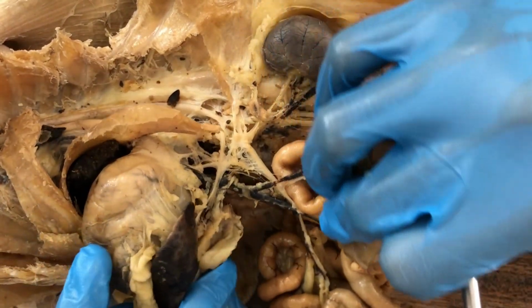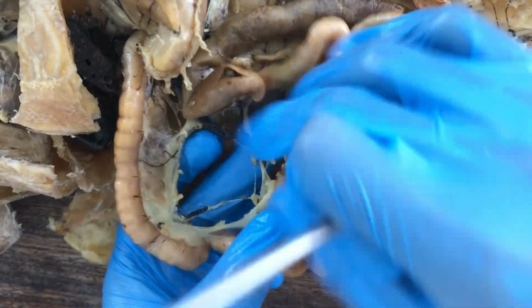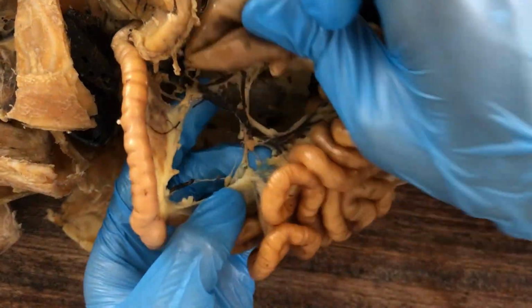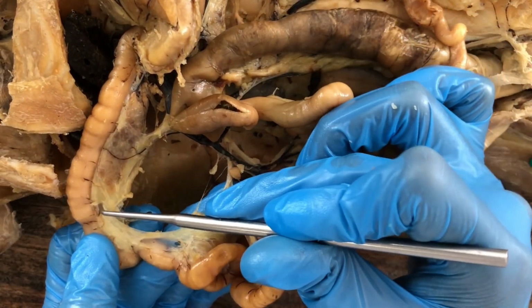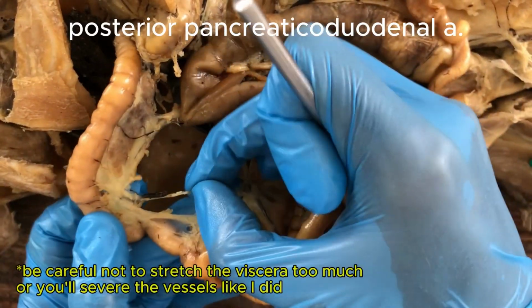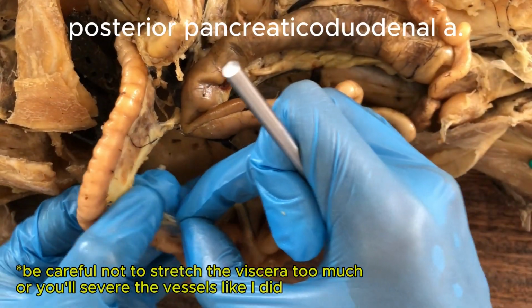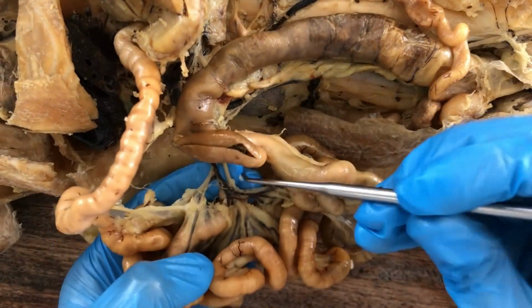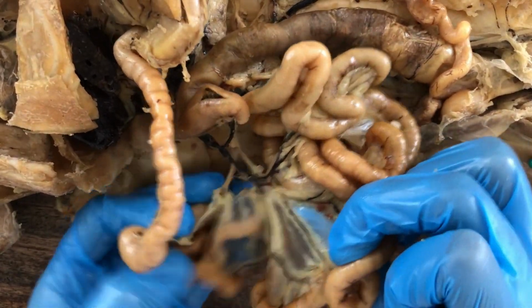And let me look for the posterior pancreaticoduodenal. Okay, I think it's already severed. But this is the superior mesenteric artery, and supposedly there should be a branch going to the pancreas and duodenum. That would be the posterior pancreaticoduodenal artery. I think it's this one, already severed. And then these would be the generic intestinal arteries.